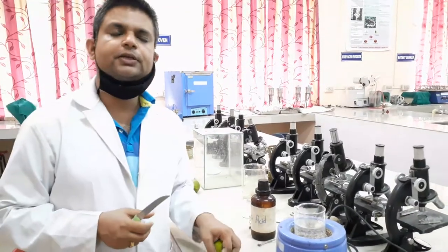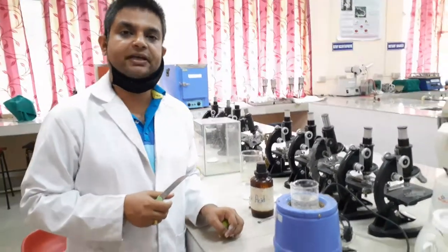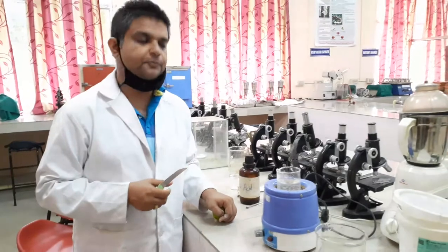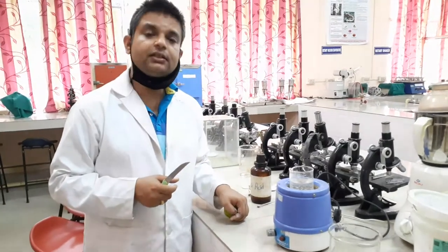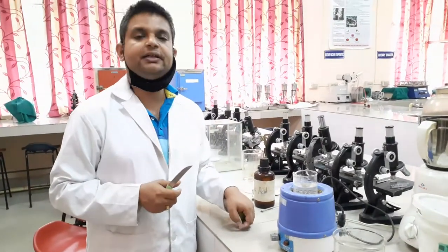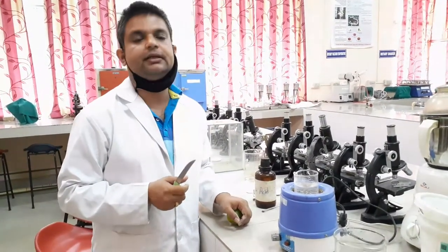In today's experiment, we are going to isolate the pectin from citrus fruit. What is pectin basically? Pectin is nothing but a polysaccharide.